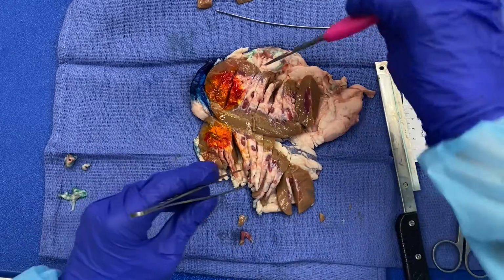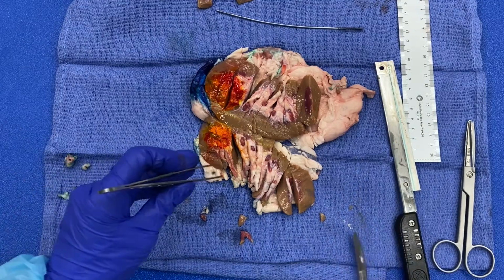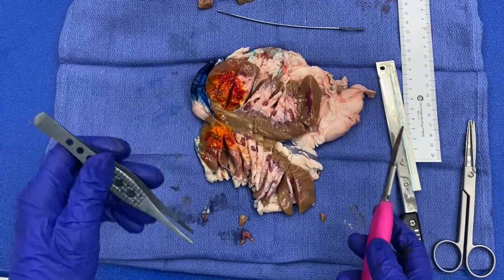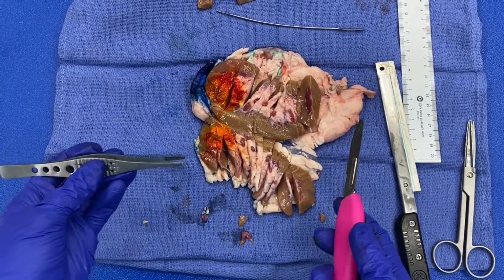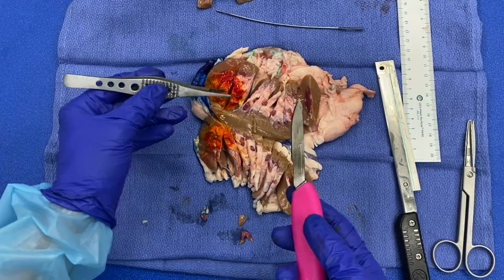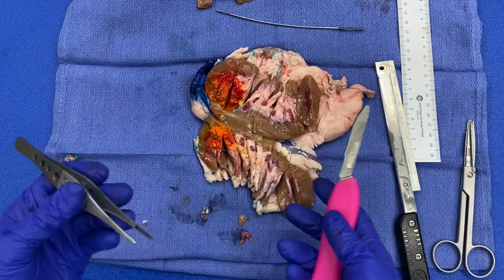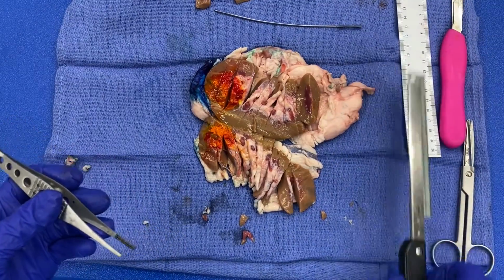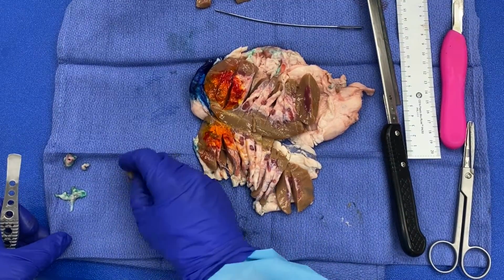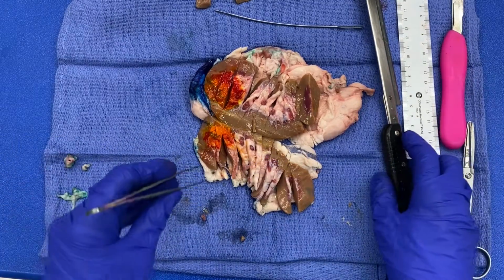So like I previously mentioned, we want to get a nice section of tumor to that renal sinus fat. Again, I just want to emphasize that after you serially section your mass, you need to measure it in 3 dimensions. Measure the distance to the capsule, the closest approach, and then the distance to Gerota's fascia. So I know I'm cutting over here. You want to make sure you do that. Examine all aspects of the mass before taking your sections, ensuring that your measurements are accurate when you're getting your approaches to surrounding structures. So please be careful as you are doing those measurements, as you are doing those cuts.